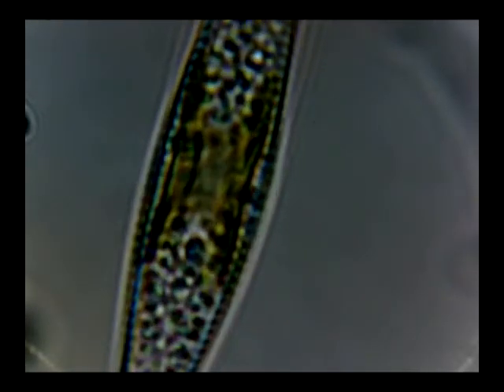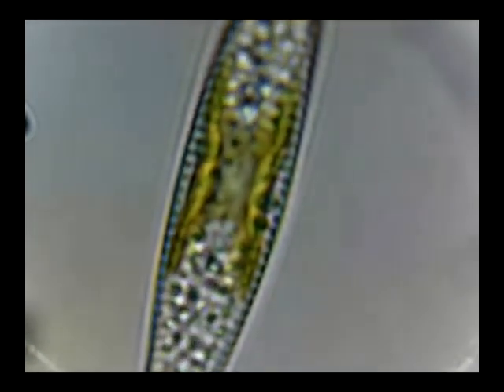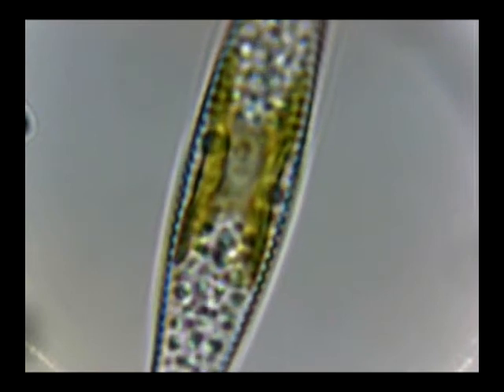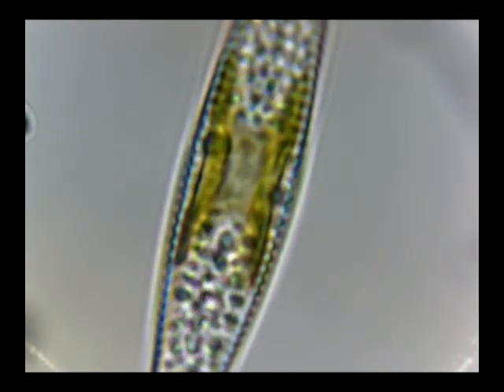I'm very near the target. Let me move around just a bit to see if I can find it — whatever the appropriate pronoun is. It's always best to leave gender out of these things. Ah, here we are — bring it into focus carefully. That was past focus actually. Oh wow, look at the detail! I never expected that level of detail.